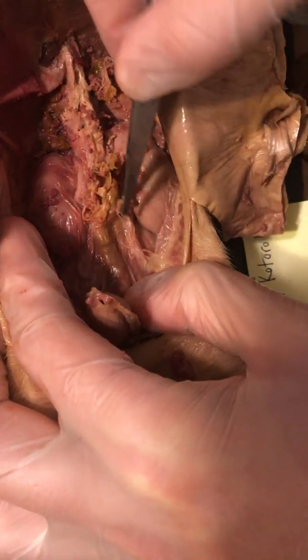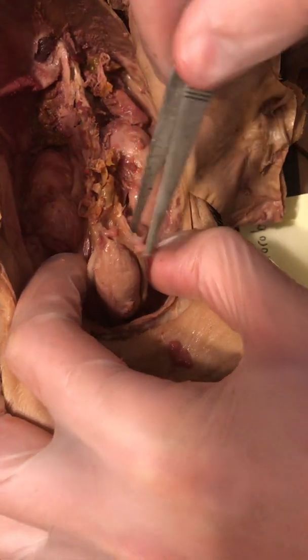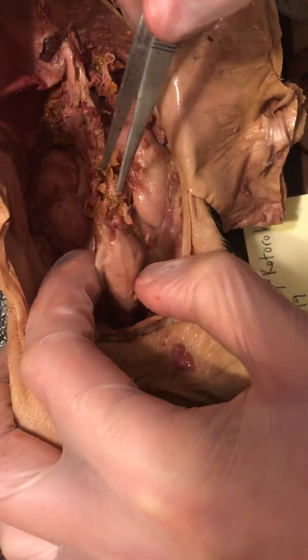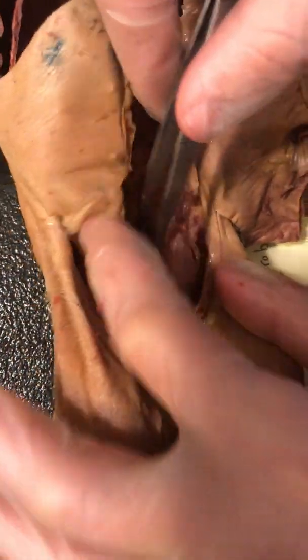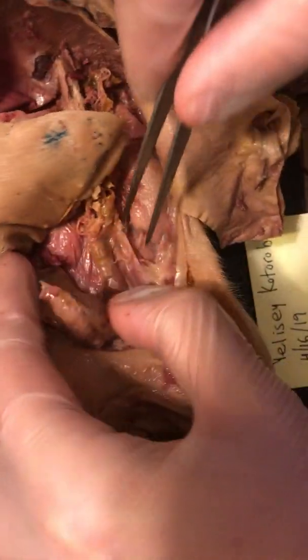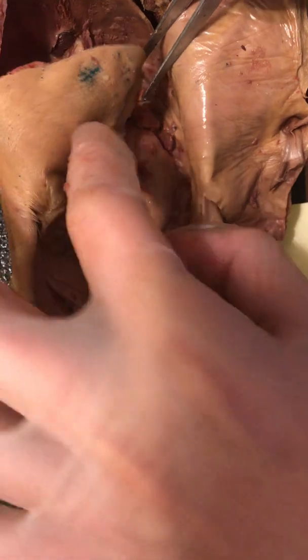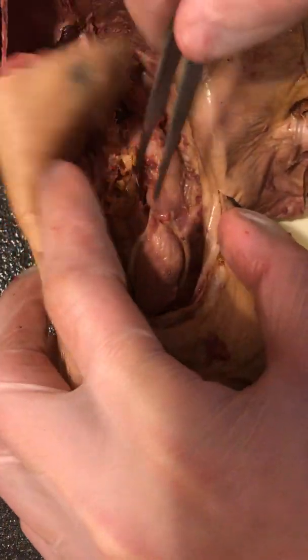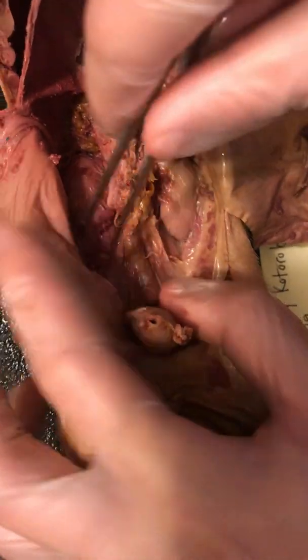Alright. I think this was the bladder. Because, okay, look, the way it is, if you're looking at the position of the animal, the ureters are actually still intact. See? Here and here. So if the pig was standing on all fours, this would have been where the pee came out. It would be underneath the pig, you know?